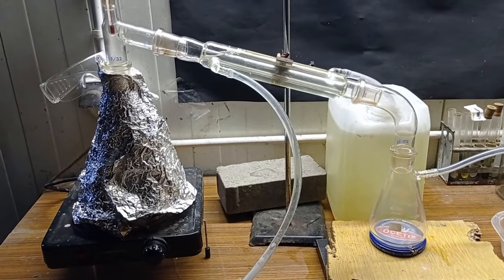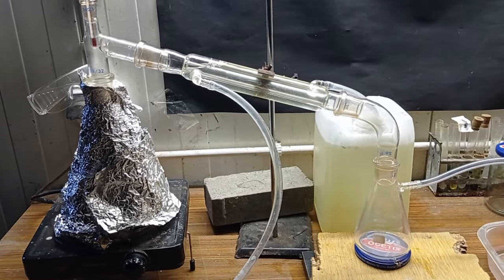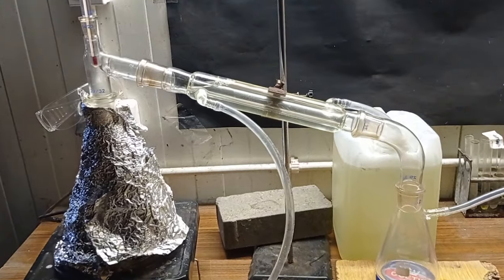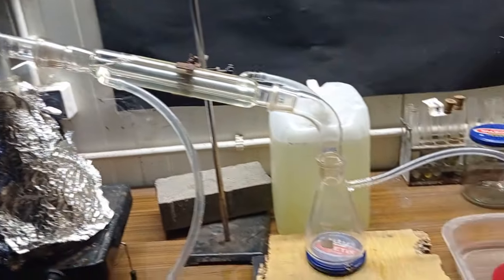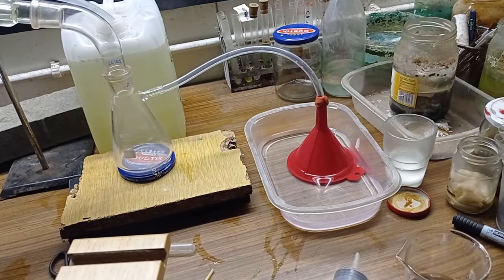After finishing the addition, I prepared the distillation apparatus and started the heating process. I waited for first fumes to drop and then attached a flask with a gas trap filled with sodium carbonate.